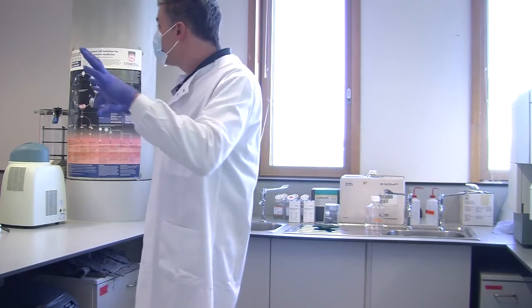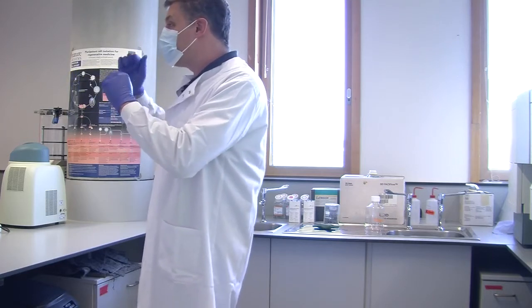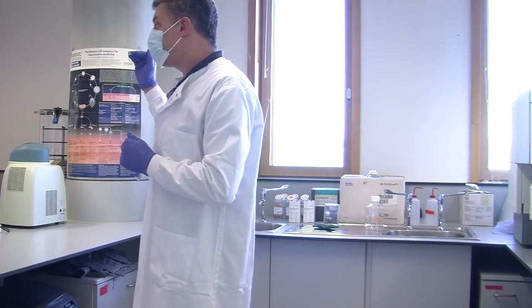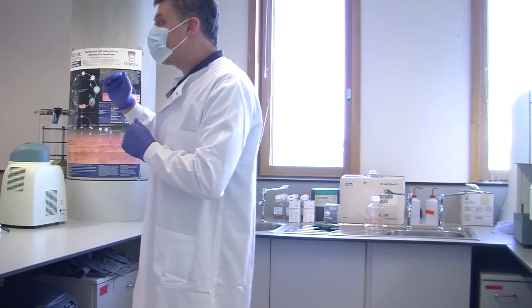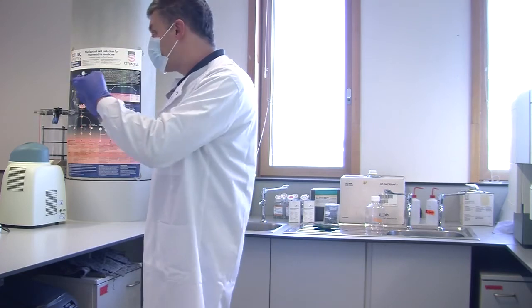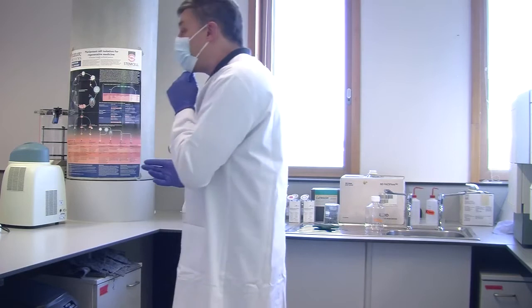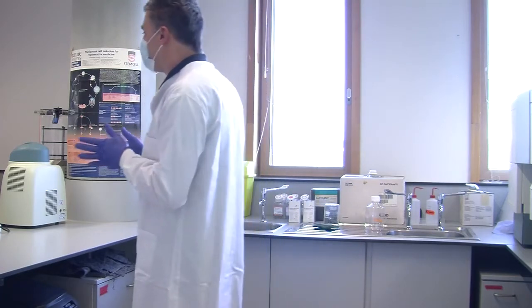So it looks at the 96 wells, looks at the colours, where the software has graded it low, medium, high, very high, whatever. It assesses what ones to work at, and then it alerts the scientists and says, right, you need to look in more detail at this one, and this one, and this one, and this one. And it's brilliant. It's great. And now, I mean, all right, you've got about £1.5 million worth of kit there.